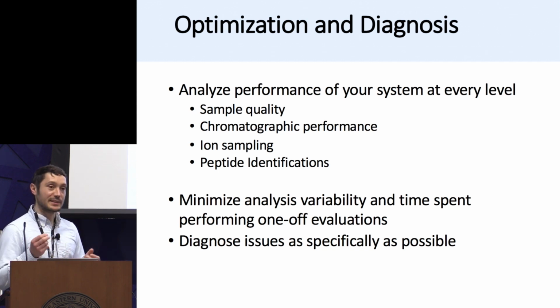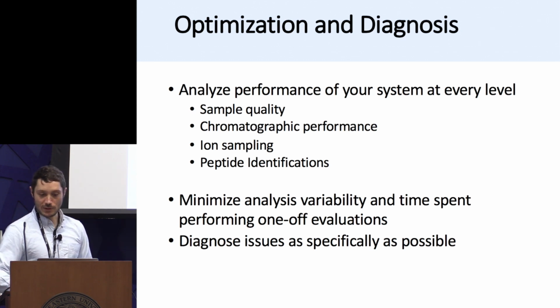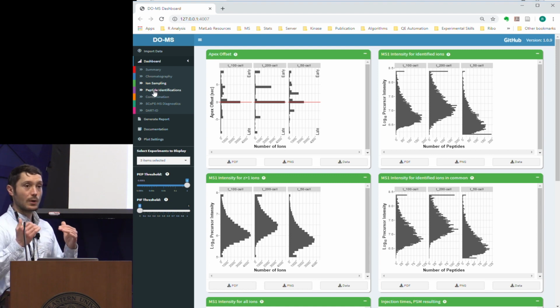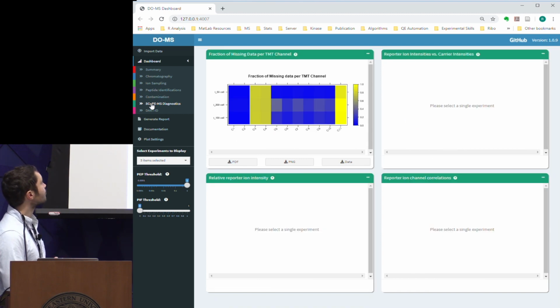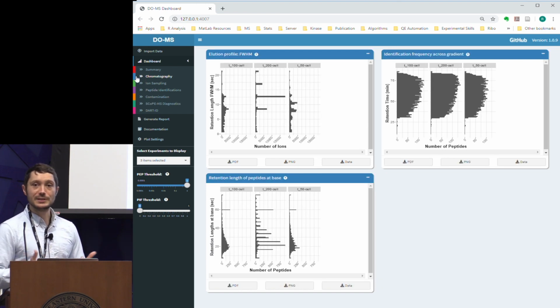Additionally, you'd want to be able to diagnose issues as specifically as possible. And that comes back to breaking things down on the level of where they occur in the system. So we took these considerations in mind, and based on these considerations, we developed DoMS, which is a way of visualizing your results from a software platform like MaxQuant. You can see on the left-hand side that there's an organizational principle for whether you're looking at chromatography, ion sampling, peptide identifications, contamination, and even some metrics that are more directed towards single-cell proteomics. And there are also some additional items that we'll return to when we do a live demonstration to see how this works.